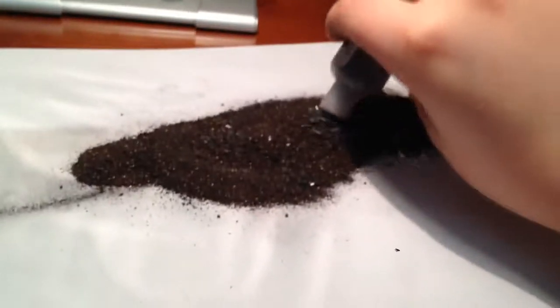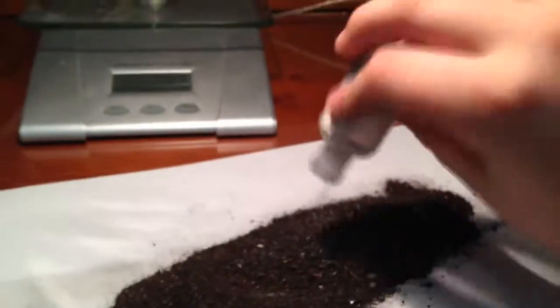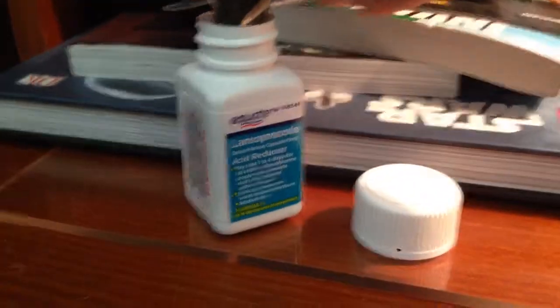Here you can see I'll empty a vial of pre-existing iron I had. I'm going to transfer it into an even bigger vial because this one won't hold it all. I simply just pour it into a bigger vial made for storing medicine, and it's all the way full.